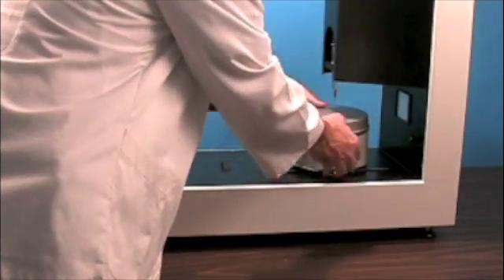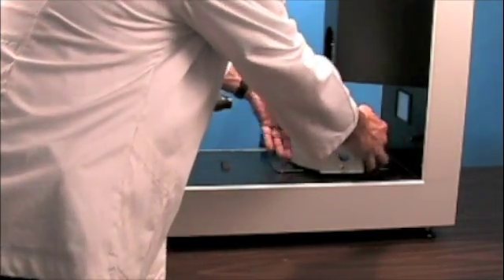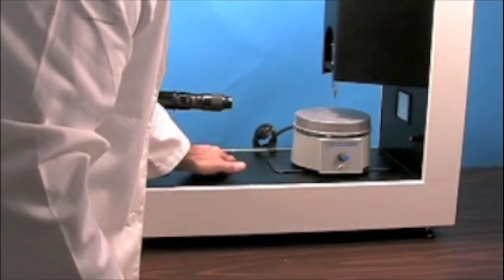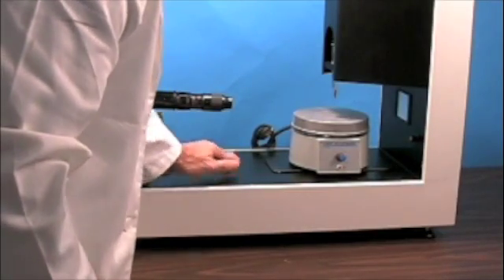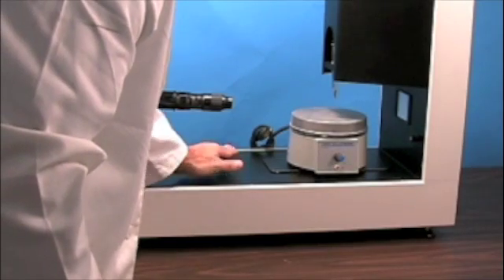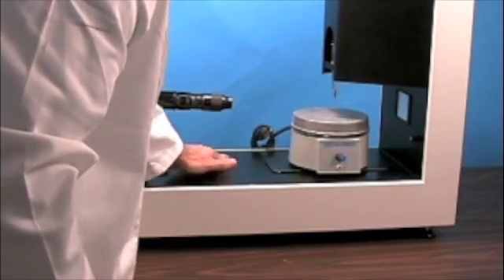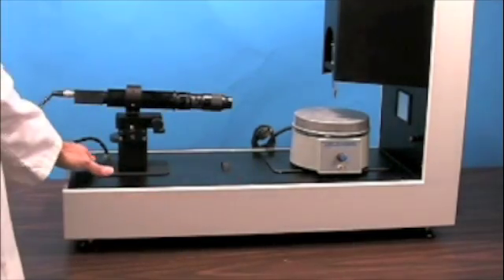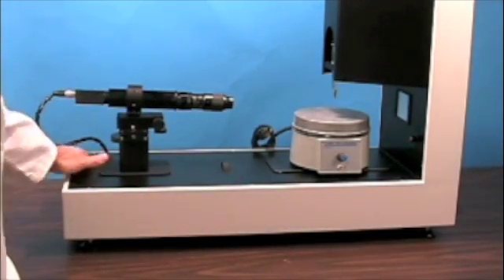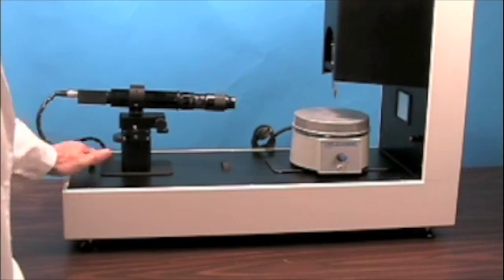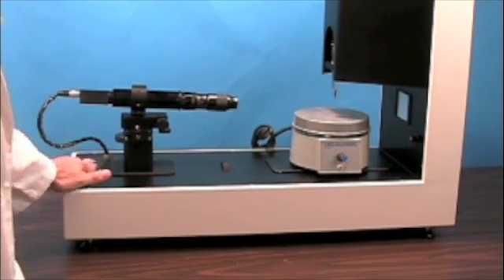There's definitely room here, and we can also move it forward and backwards, as well as move our camera forward.